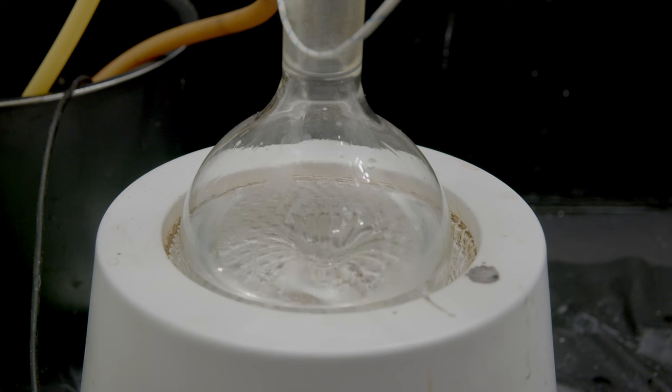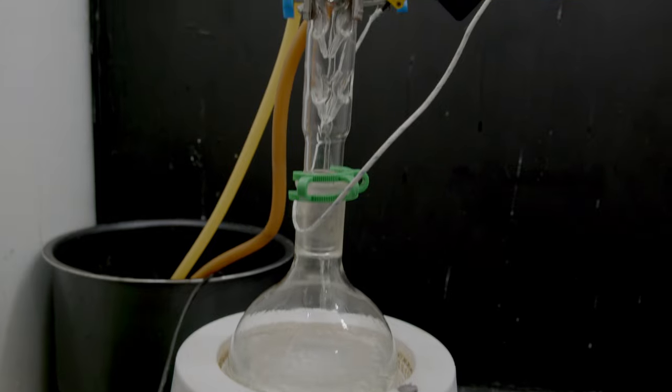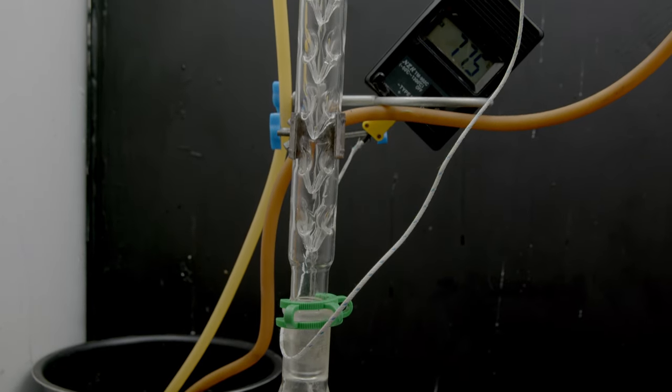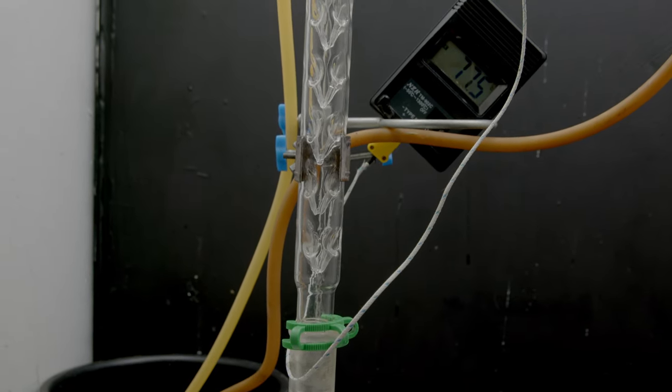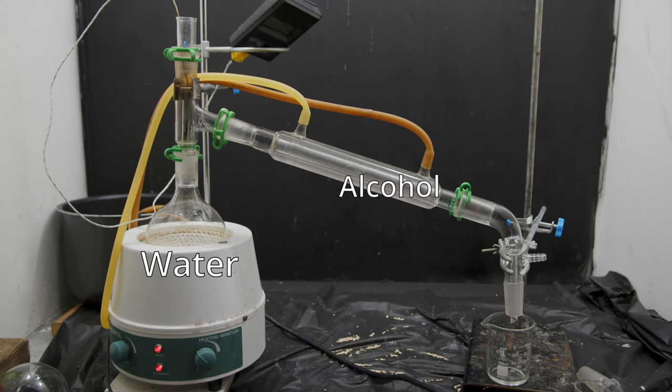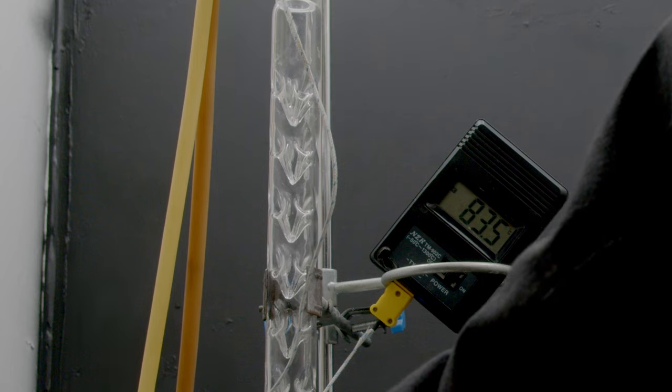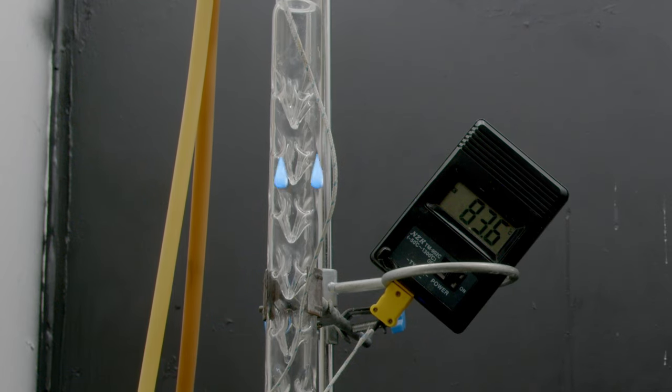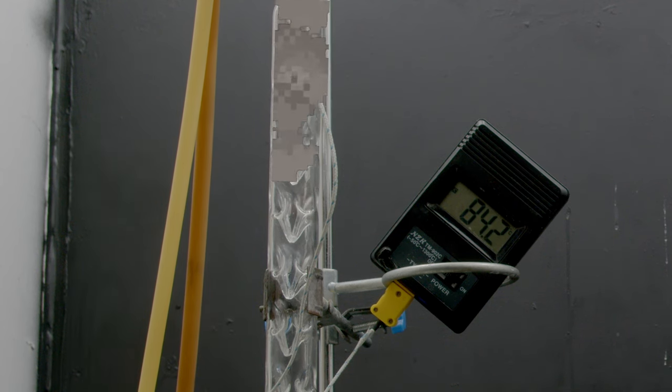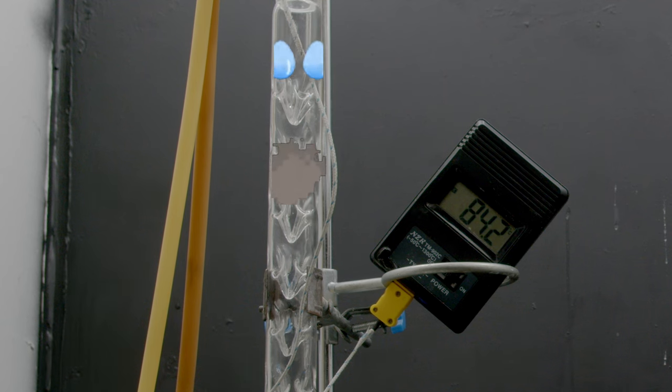If you're here for legitimate purposes then we can start by boiling it off. And now we can begin to see the power of the distillation column. Now you may be familiar with normal distillation which separates things based off of boiling point, but by adding this column we actually make this process more efficient. This is because as the column heats up the liquids condense on the sides and then boil again, creating effectively multiple distillations with one. That makes our products a lot more pure than if we were just to do simple distillation.